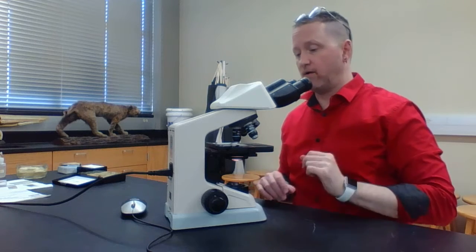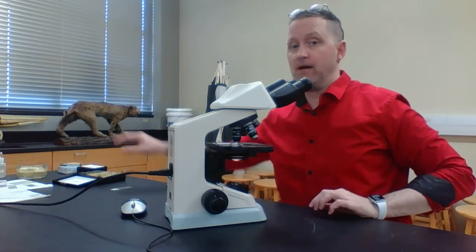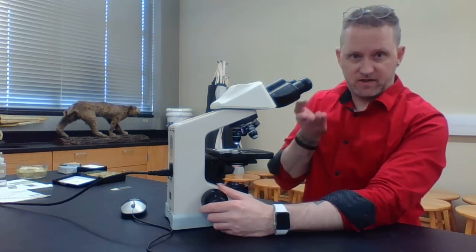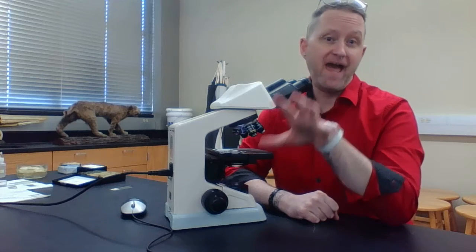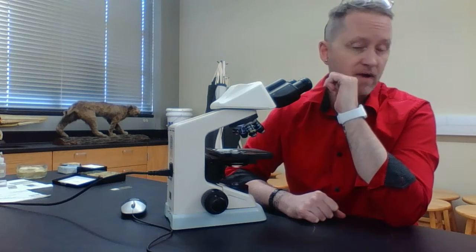So again, this is basically how you view it. And for us, at least when we start off, once I take my microscope slide and put it in the back and grab another microscope slide, always make sure that the stage is furthest away from your objective and always go back down to the scanning objective and start over. This will actually teach you how to use a microscope.